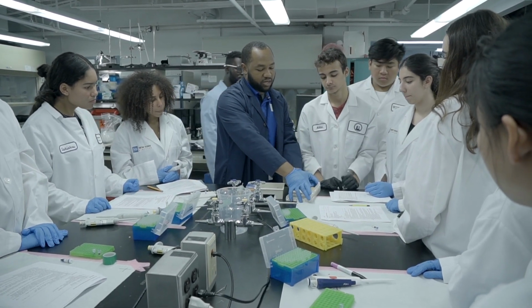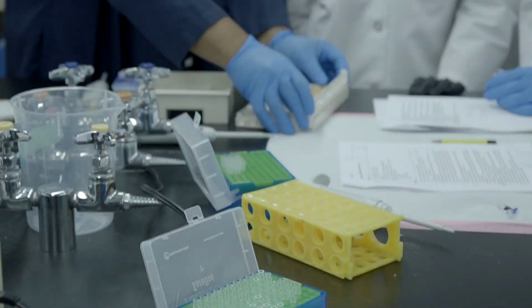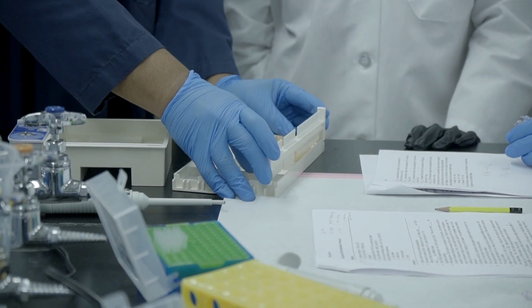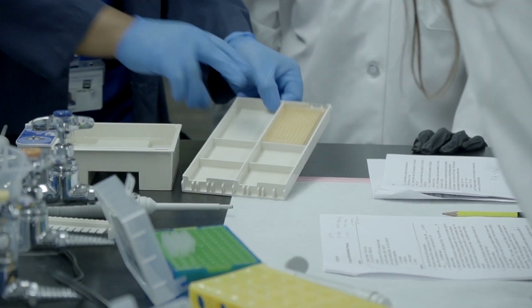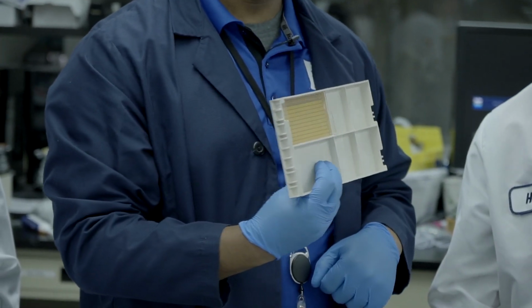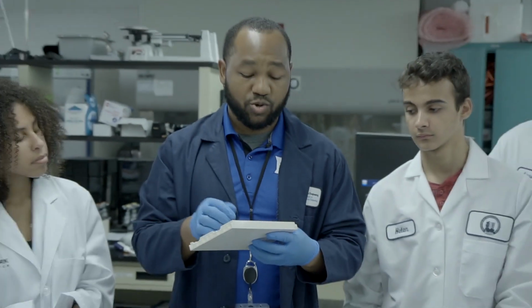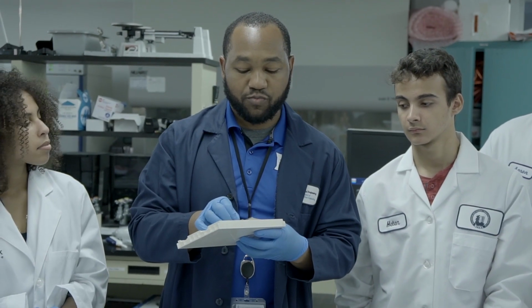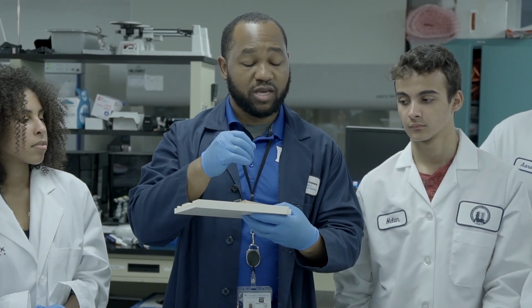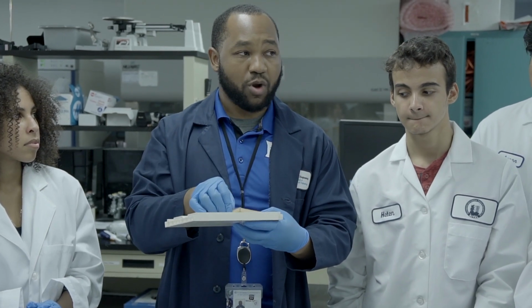I'm going to very carefully pull straight up on the comb so that I don't mess up the lanes that I've created. It's kind of tight, but I don't want to do it sideways. As you can see now, there's 17 little slots. That's where our samples are going to go. I'm going to do the first lane, inject the ladder, and show you how. The primary thing is to go straight in slowly and not go back and forth, because if you puncture your lane, your DNA is not going to run properly.